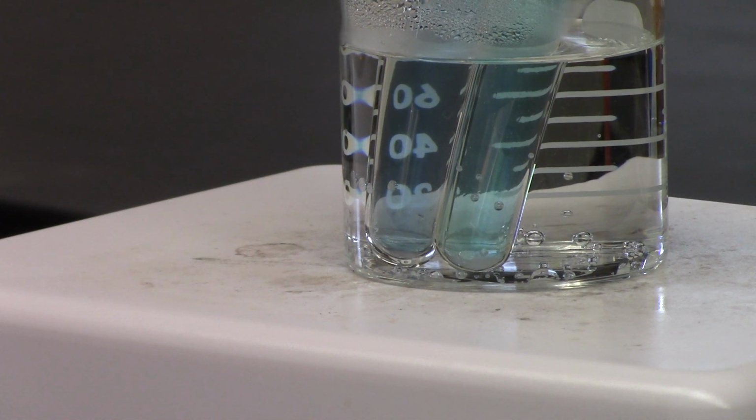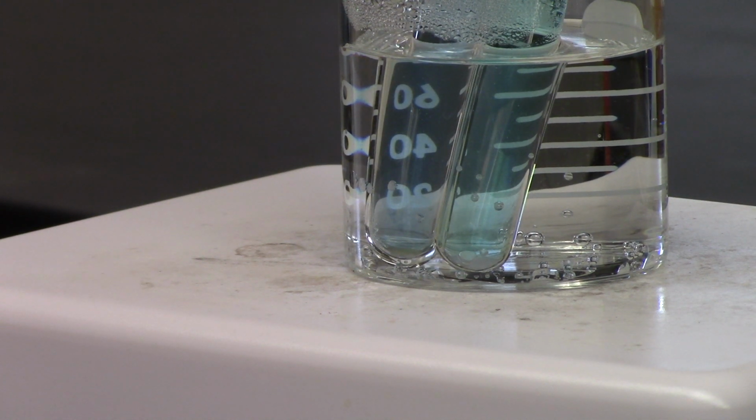As you can see, the acid one is already a slightly different shade of blue. Hopefully we'll see something soon. Sometimes patience is hard to come by, especially in these days. We have to be patient. I'm sure we'll see a positive result. Or at least an interesting result.